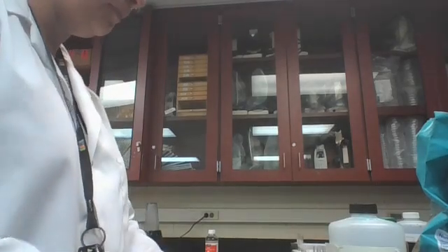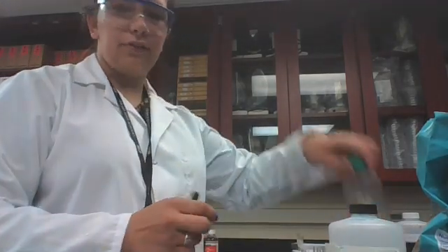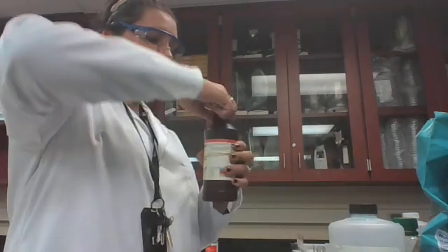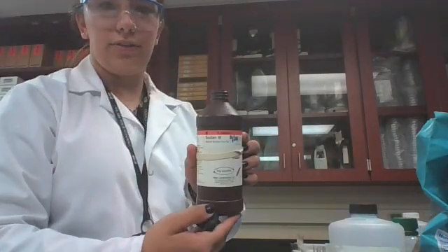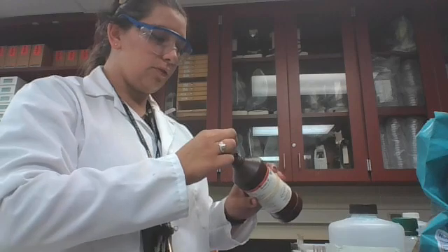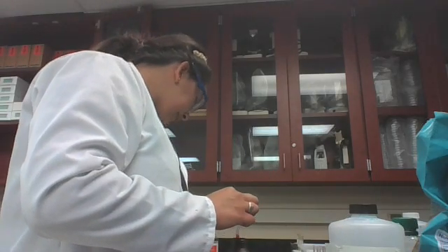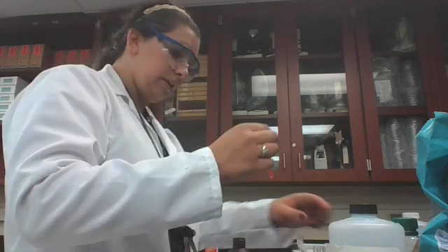Our next one is a lipid test. So the lipid test is Sudan-3 stain. In the presence of lipids, fat cells will turn red and form a fatty layer on top of the liquid surface. Let's check this out for our test so we know what to look for. This is just canola oil that we're testing. And Sudan-3 alcohol solution. So it says here we're going to take 6 drops of Sudan-3 into the test tube.